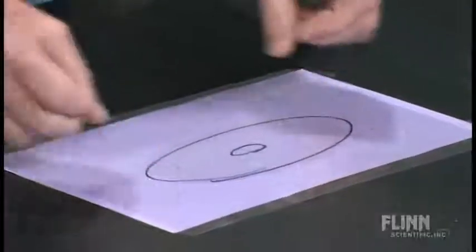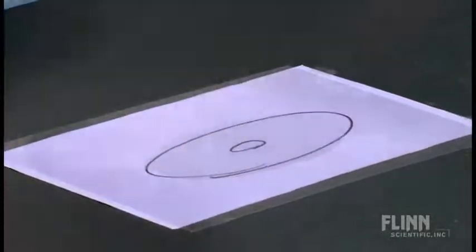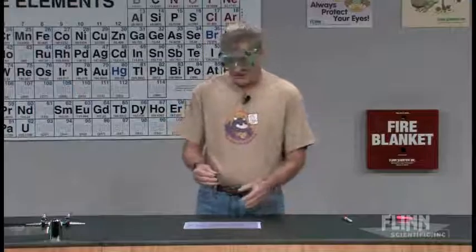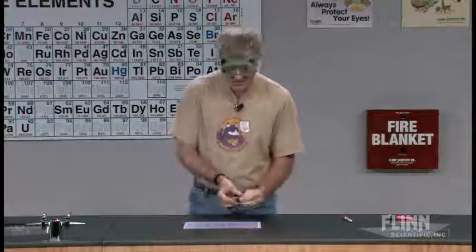This one's a little large. I think usually they just fit over that part. But that'll work. And now I can come into this and say, all right, if you're in the lab, and through some unbelievable set of circumstances, liquid gets through your safety glasses, what's going to happen if you're wearing a contact lens?